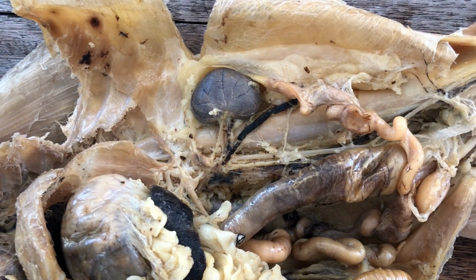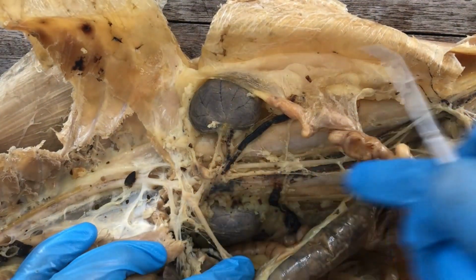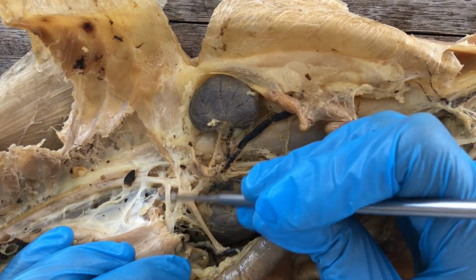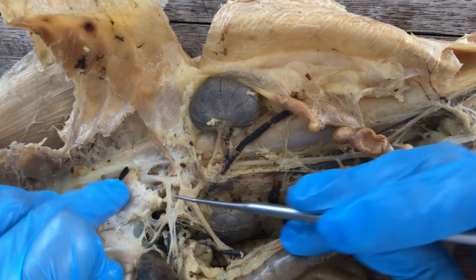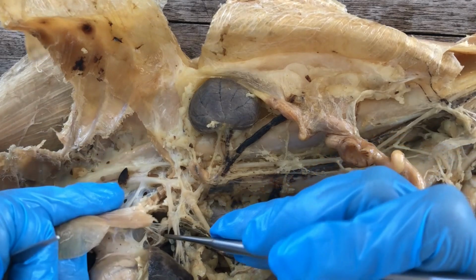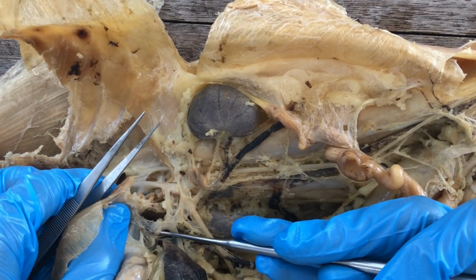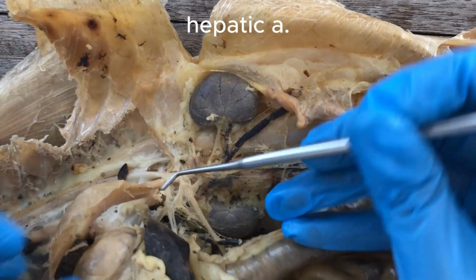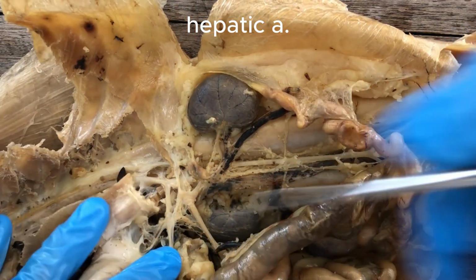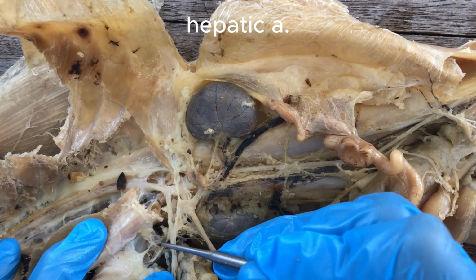Okay, so what we're going to do is examine what we can see of the branches of those three visceral arterial trunks of the abdominal aorta. Let's start with the celiac artery. The celiac artery has three sub-branches. One going to the liver down there, that's going to be the hepatic artery. It's going to be more visible on the right side later.